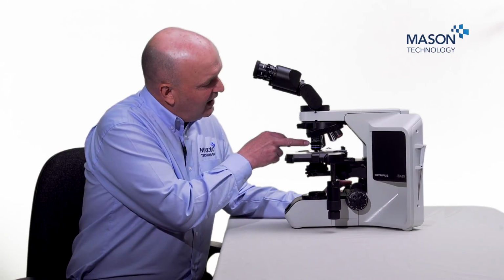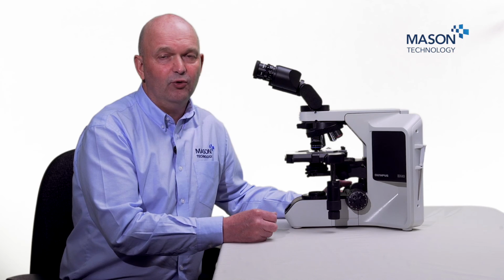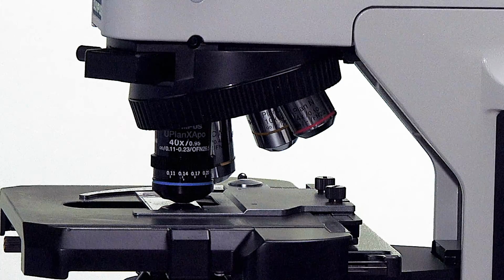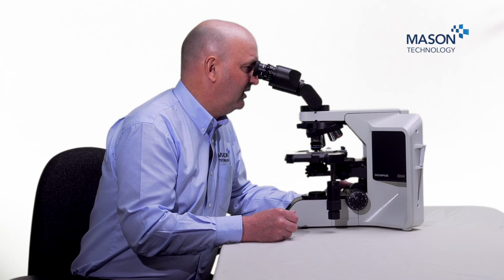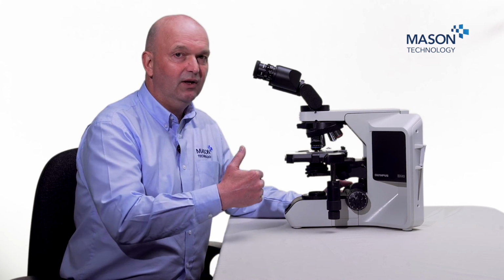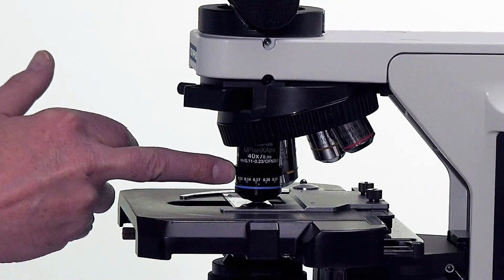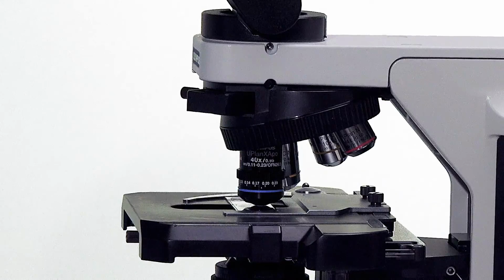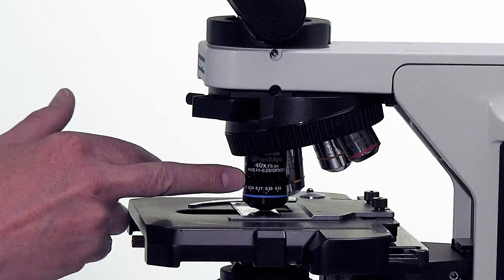However, sometimes they're thinner. So if I go down to 0.14, I can just have a little look and see does that improve it. If it does improve it, then we can try going down a little bit further. And if that improves it more, you keep going until you get to the optimal position. If, however, it's the opposite and it gets worse, go back to your 0.17 and then start to move upwards. Keep doing that until you get to the optimal position.